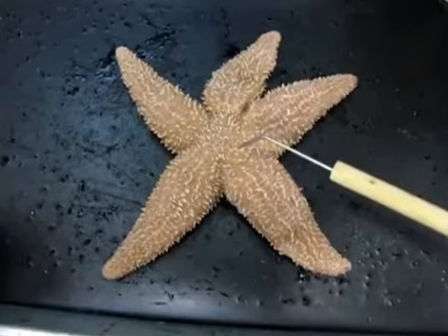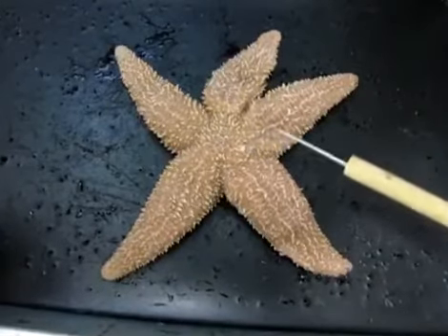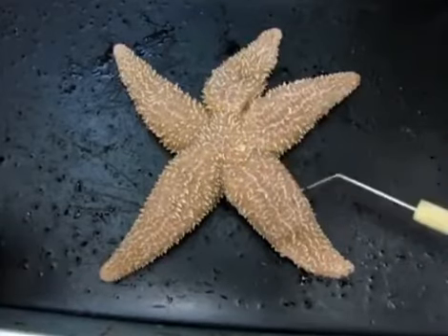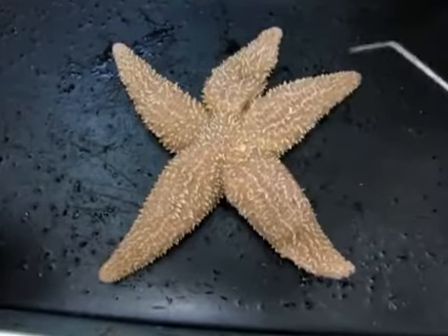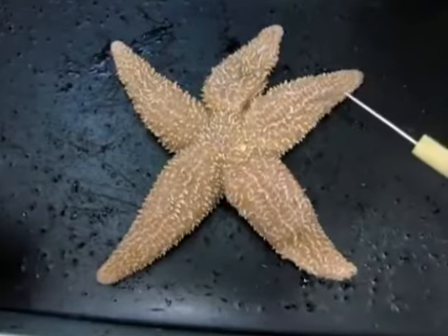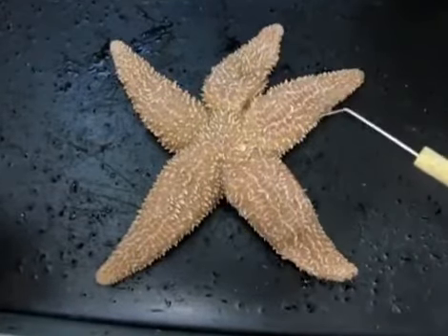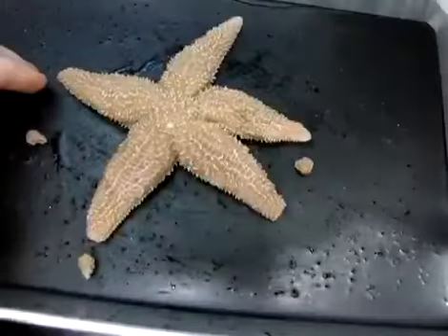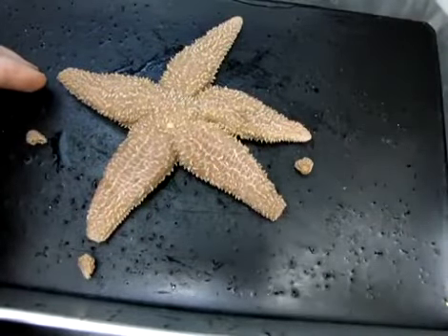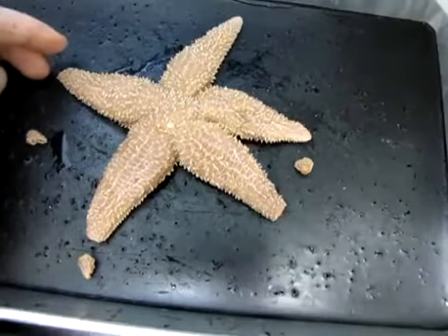And the madreporite is very important in that it allows water to enter the body through a system called the water vascular system. And we'll see more parts of the water vascular system later, as well as how it's involved in things like locomotion. I'm quickly going to explain how I would like you to begin your dissection, just in case the instructions in your handout aren't clear.